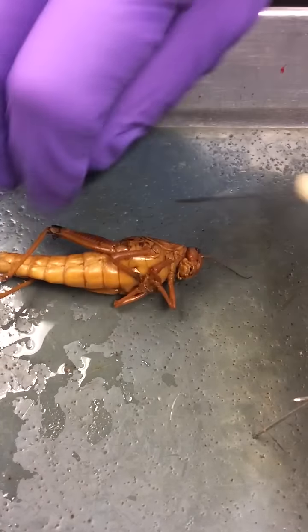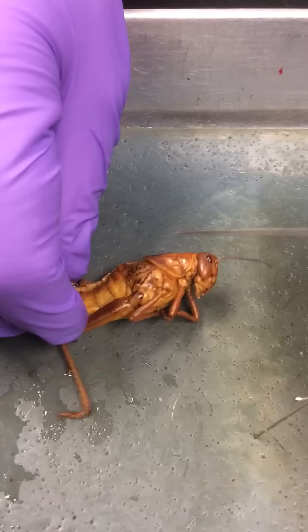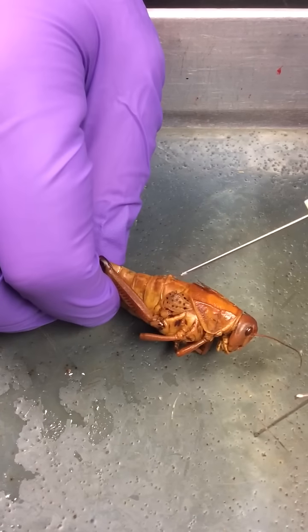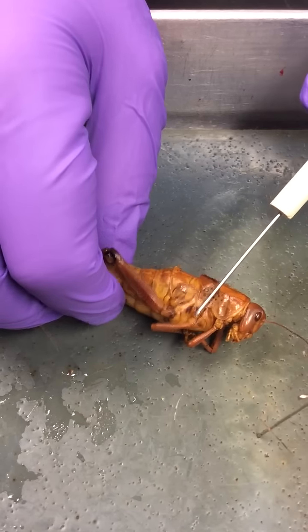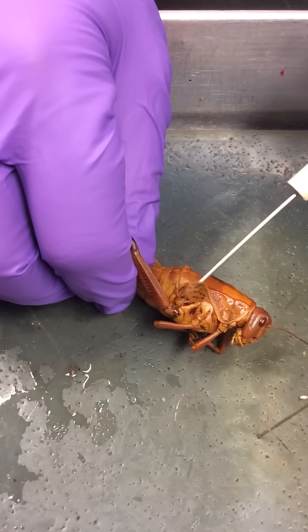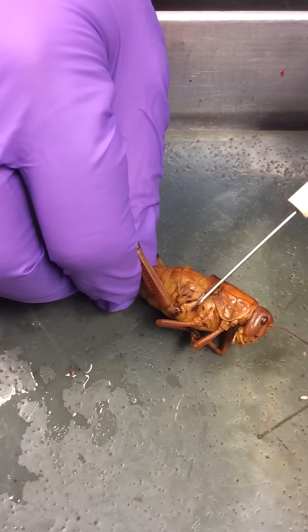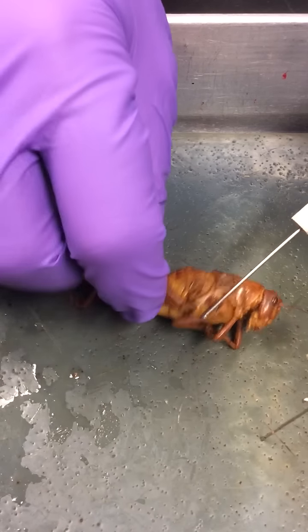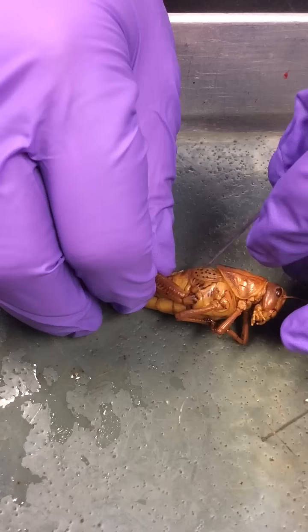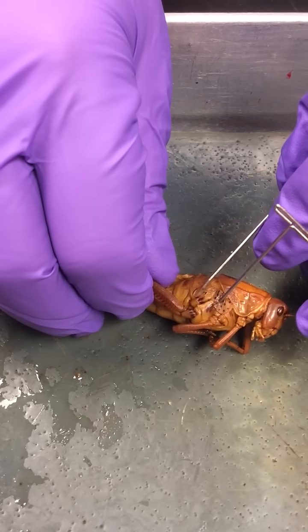We'll continue our investigation with the posterior portion of the thorax. We're looking at the wing. There's the forewing right here. Then we'll flip it forward, and we can see a hind wing hiding there. And we'll flip it forward, and then underneath we see a tympanum, and that's the world's most annoying hind wing. There's our tympanum right there.